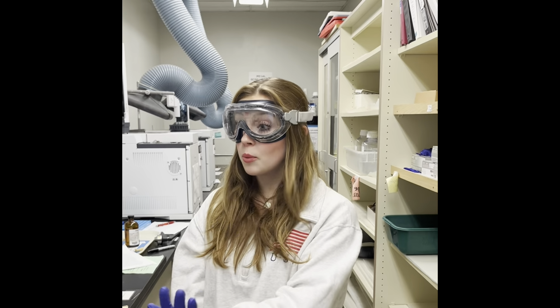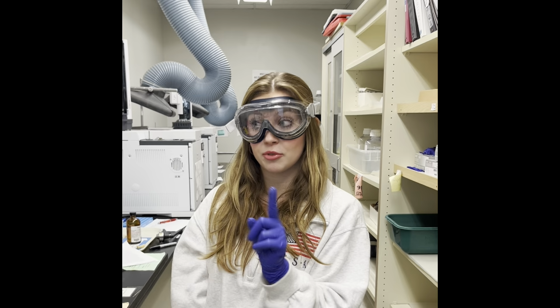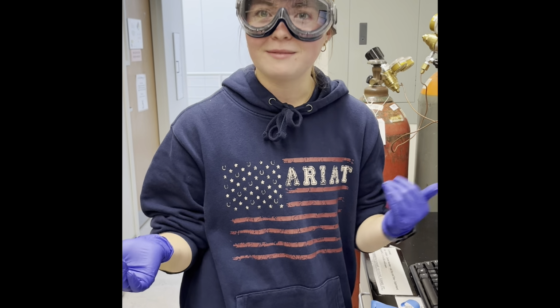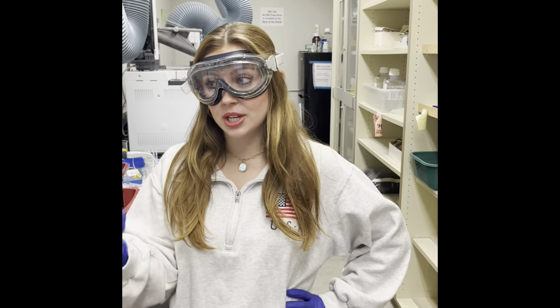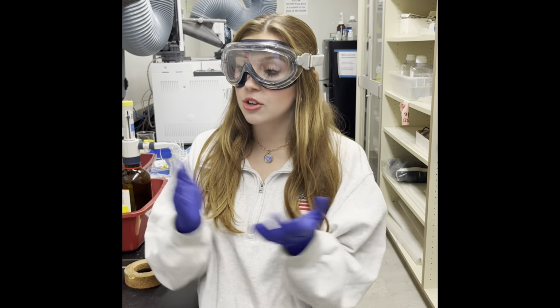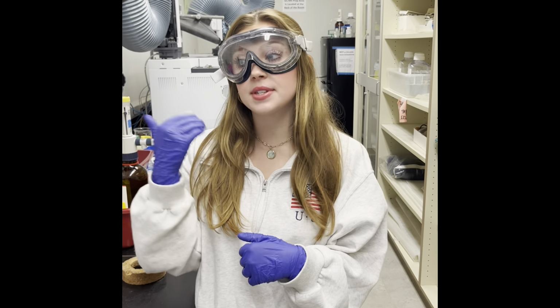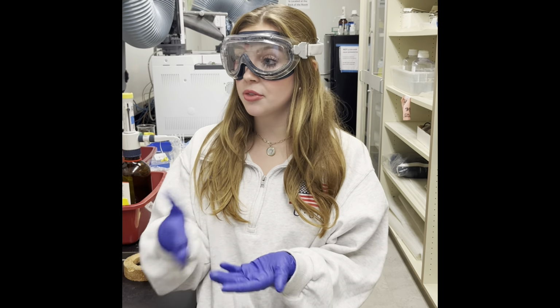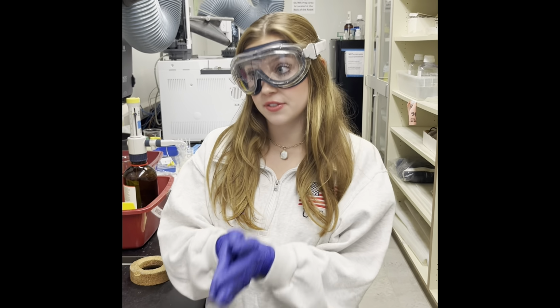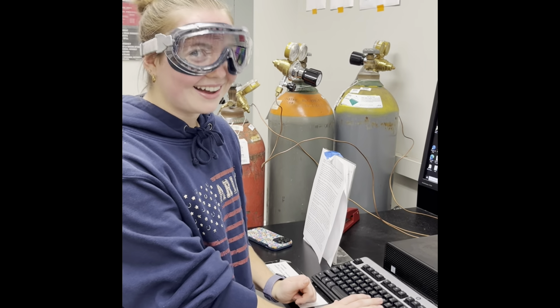Sure. Wait, make sure you take your gloves off before you work on the computer. But I thought we had to keep all of our PPE on when we work in the lab. That's true. But since we're not actively working with chemicals because our sample is already on the rack, you can go ahead and take your gloves off. Especially because if somebody else comes and types on the computer without their gloves on, you risk exposing them to harmful chemicals that were on your gloves in the first place. Okay, I got it now.